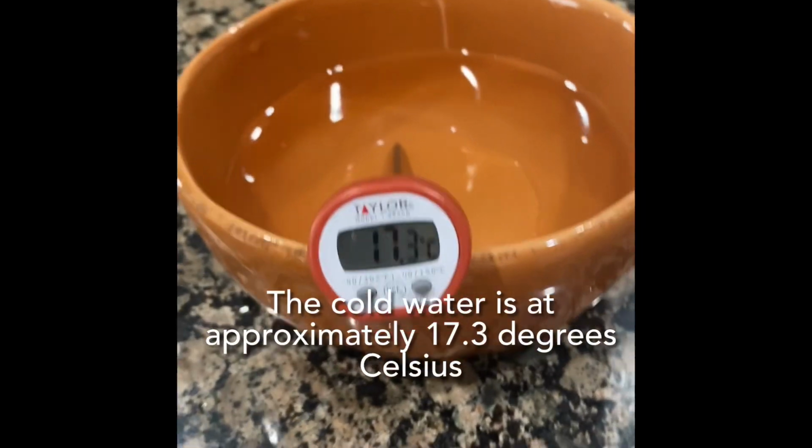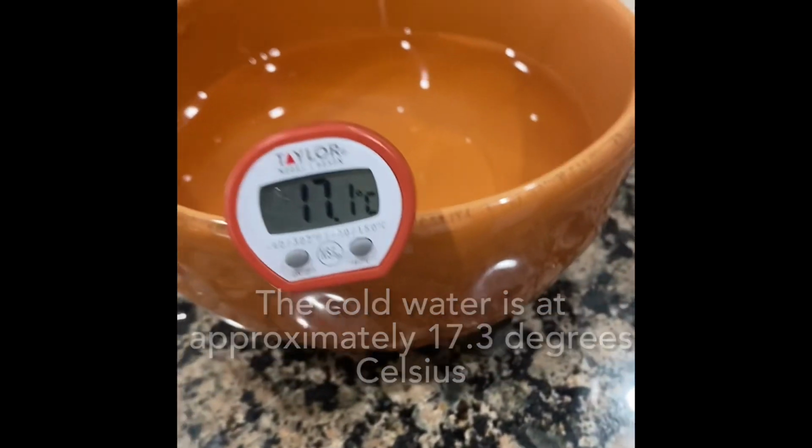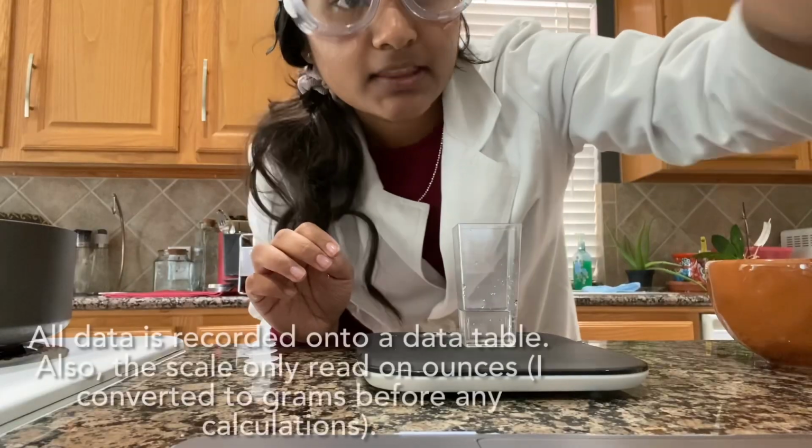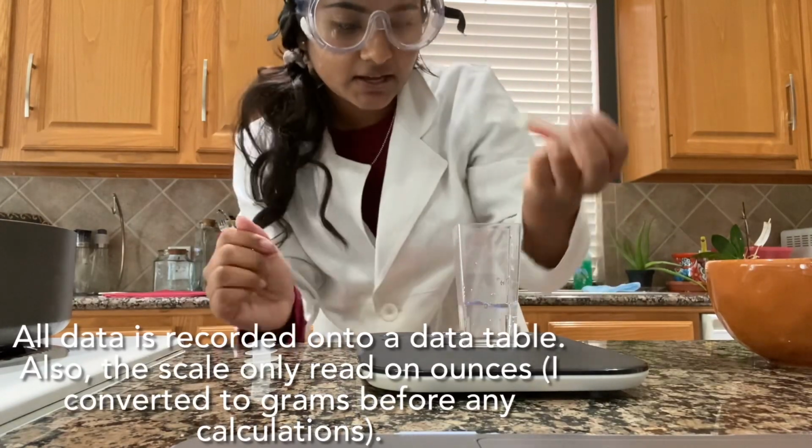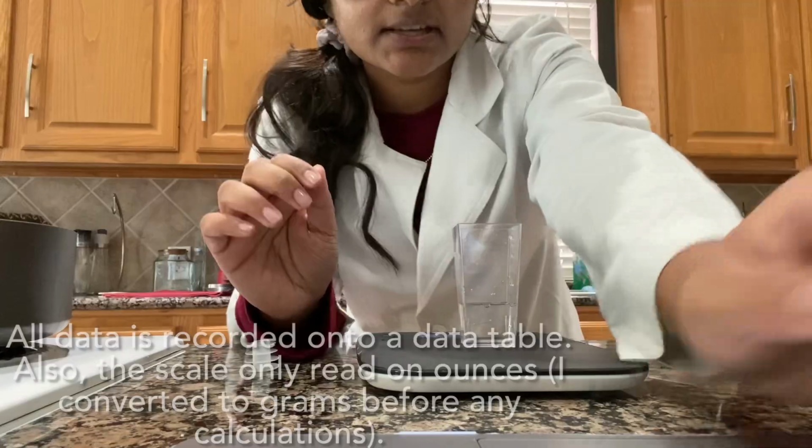The cold water is currently at 17.3 degrees Celsius. And then the last 5 milliliters brings it to 25 milliliters. And it comes out to 0.88 ounces.